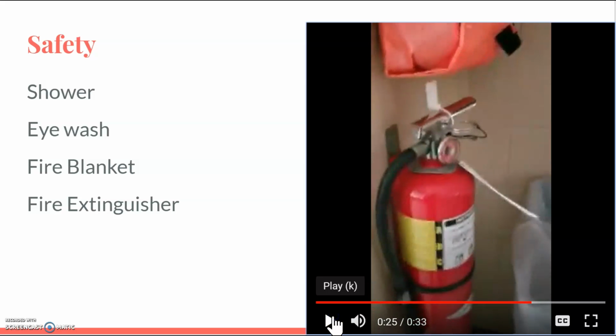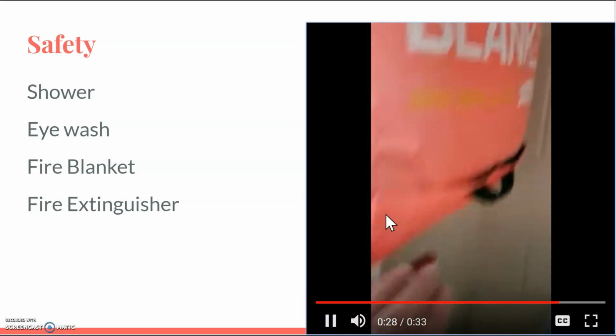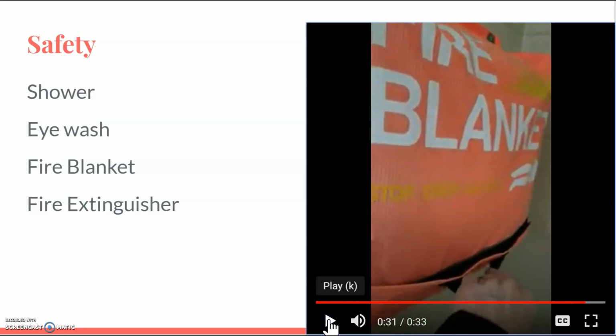If there is a fire in the class, we have two safety devices. One, a fire extinguisher, which is for objects, and we also have a fire blanket. I know how to use the fire extinguisher, so I will grab that. The fire blanket is for people. Also, for a small fire, you can get the blanket and put it over a small fire to snuff that out.